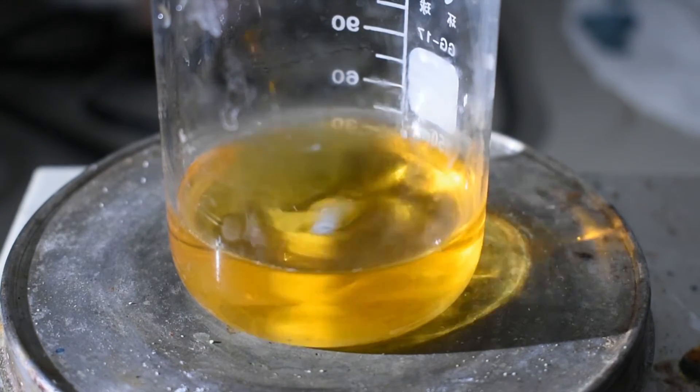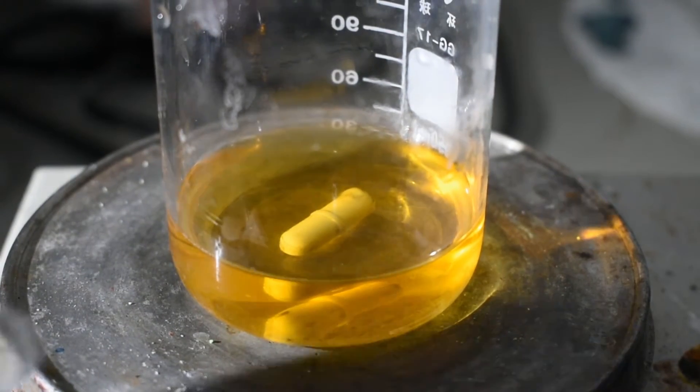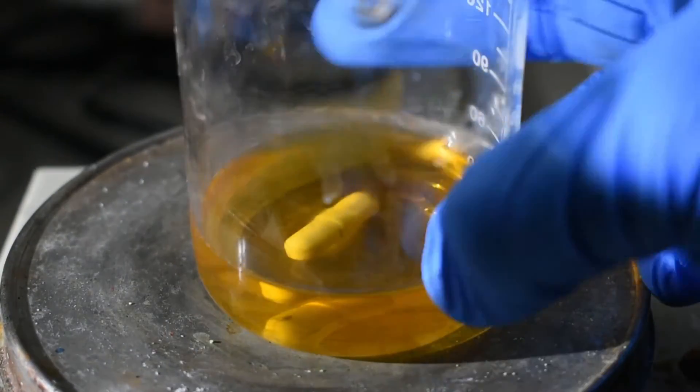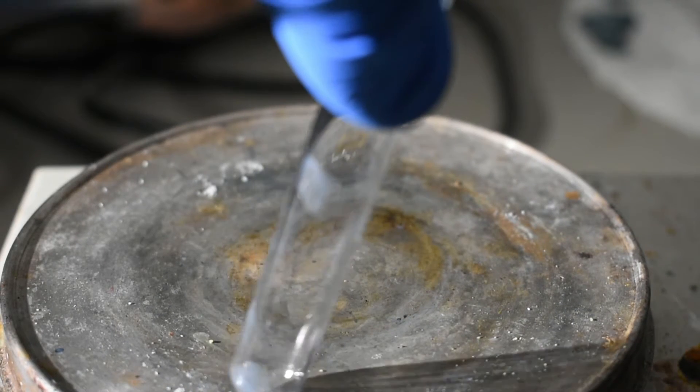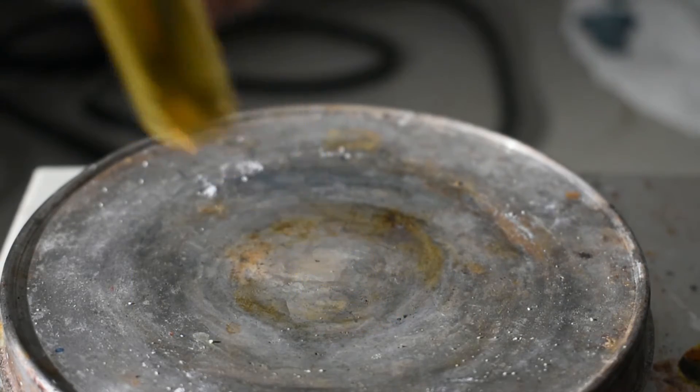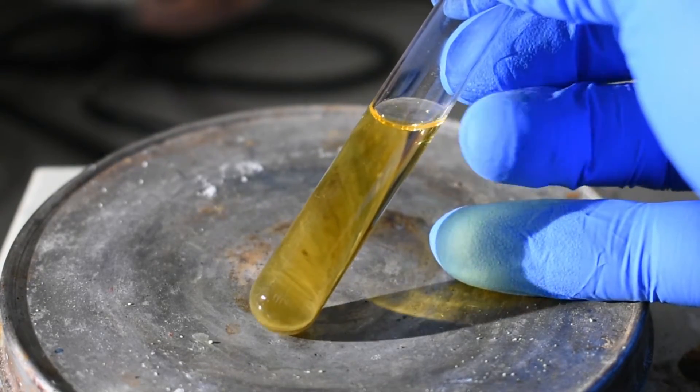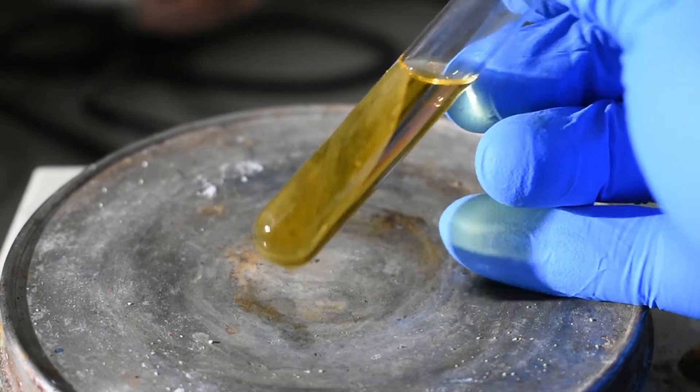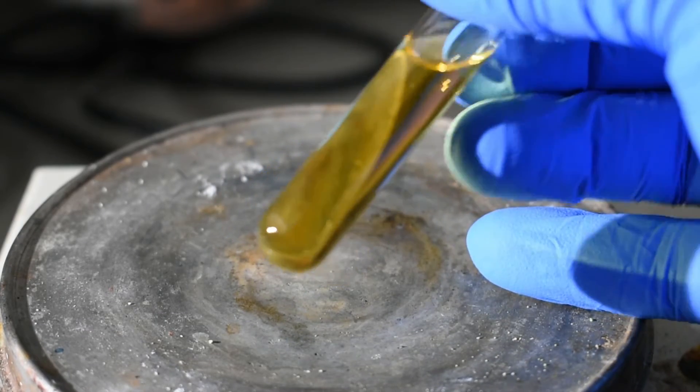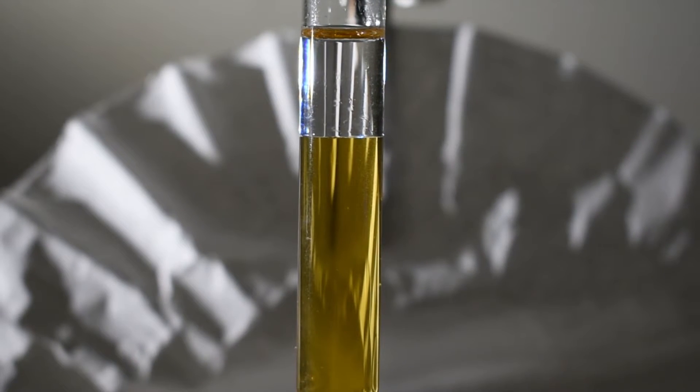Now that all of the hydroxide is dissolved, I'm going to turn off stirring and grab a test tube. To this test tube, I'm going to add a small amount of this solution. That's probably about good right there. So what I'm going to do now is add a small amount of toluene to create a protective barrier on the top of the liquid here against atmospheric oxygen. This will prevent the oxidation of the nickel(I) complex back to nickel(II) by atmospheric oxygen. So now you can see that we have a nice bright yellow layer on the bottom, and a clear layer of toluene on the top.